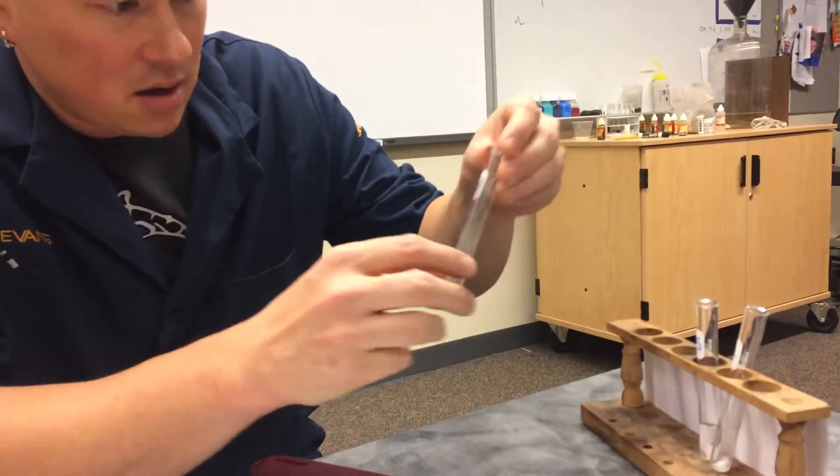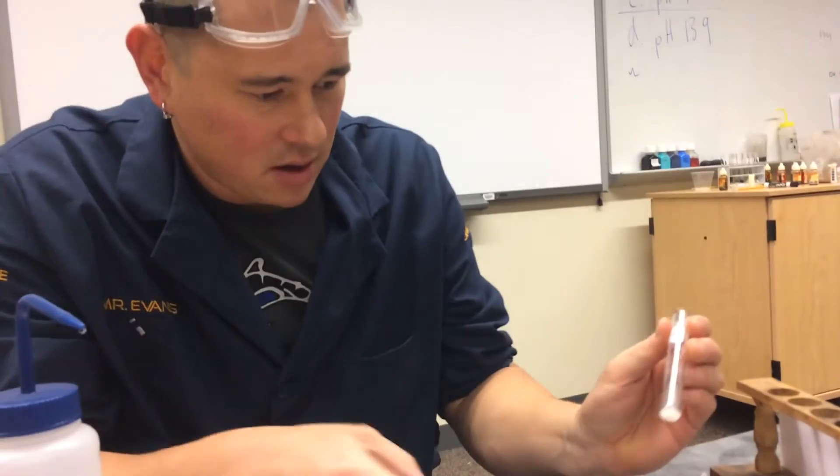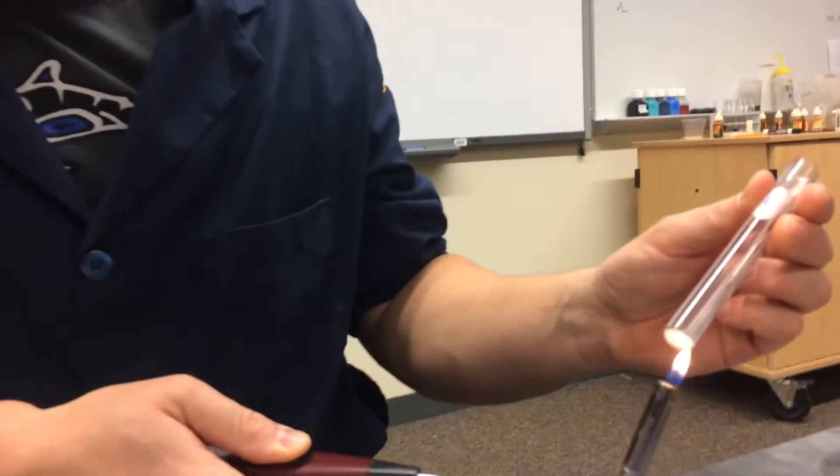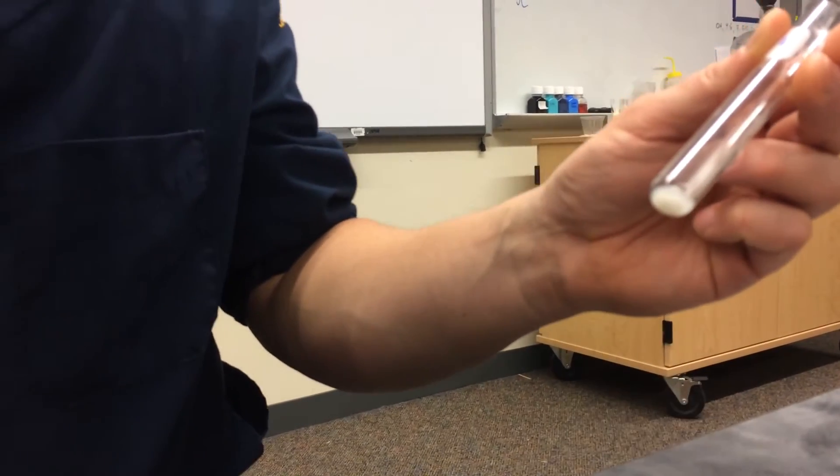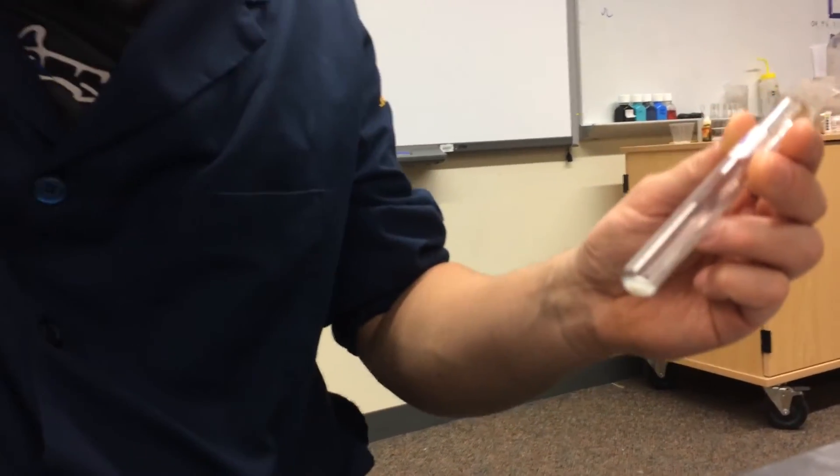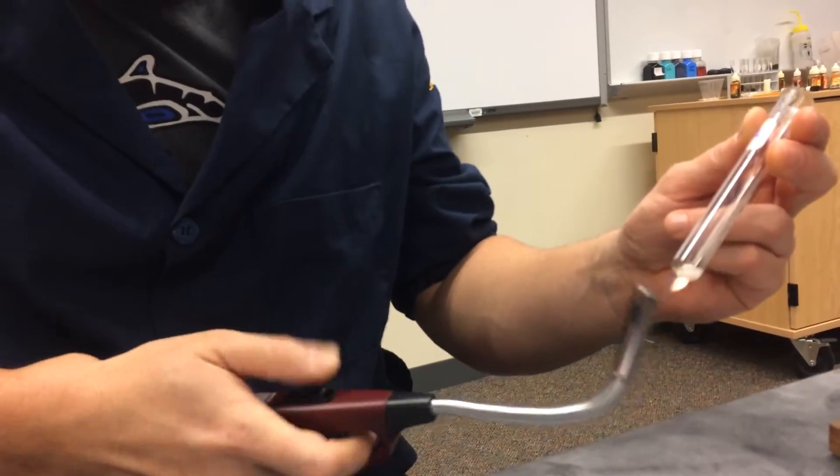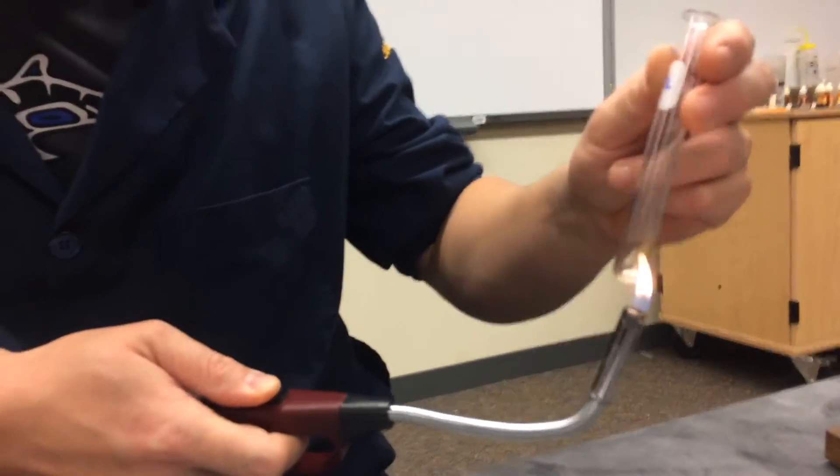And then I have the lard sample, the one that we know is lard. And this one I was just going to heat up really lightly. I'm going to put the test tube away from my face so I don't hurt myself. And, of course, I'm going to have my goggles on. Yeah, you don't want to burn all your hair that you have. Not funny. So I'm going to heat this up.